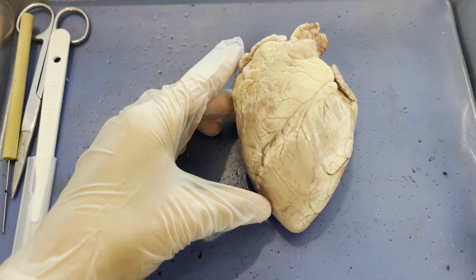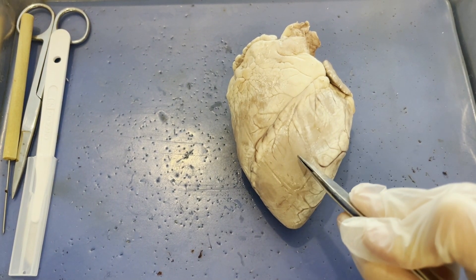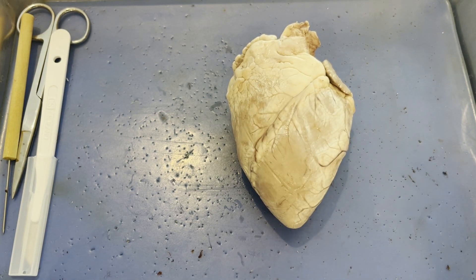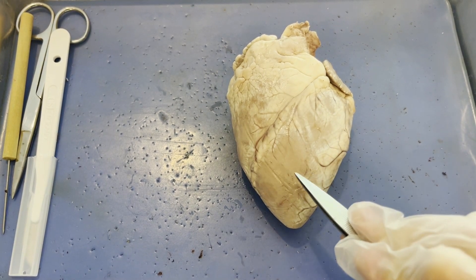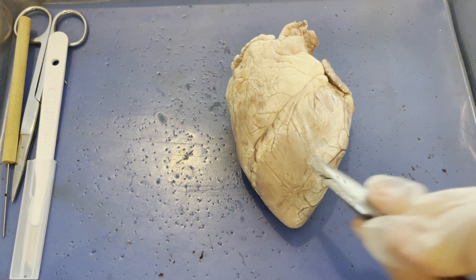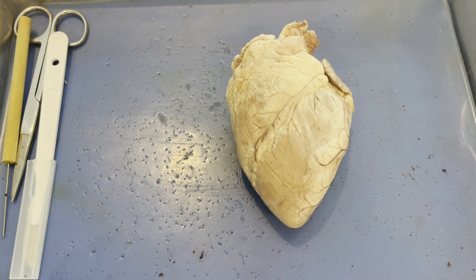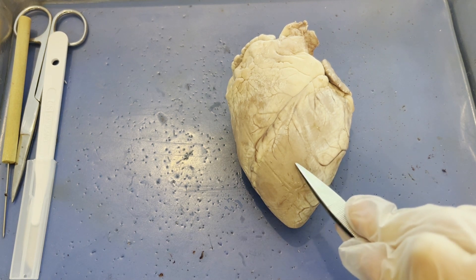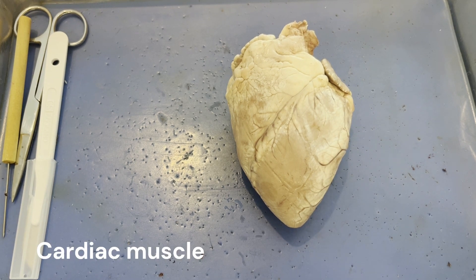Right away, you should be able to see that the heart itself is made of two main types of tissue. This grayish brown tissue that you see here is muscle. Thinking back to histology, there are three types of muscle. This is not skeletal muscle, which attaches to bones. This is not smooth muscle, found in the bladder, digestive tract, and blood vessels. Instead, this is a special type of muscle tissue exclusively found in the heart, known as cardiac muscle.